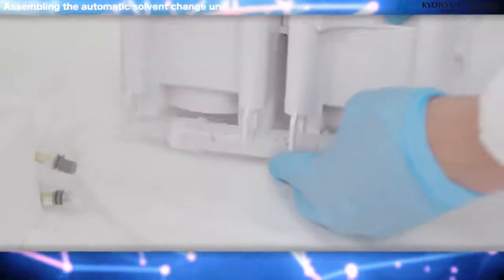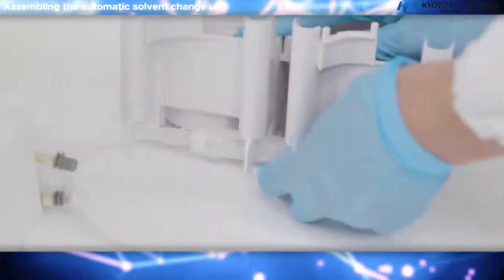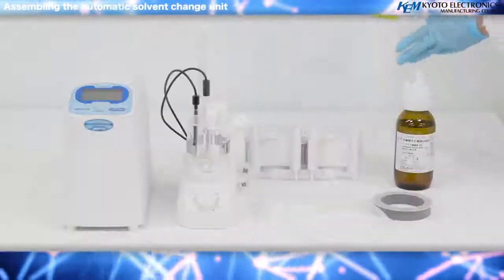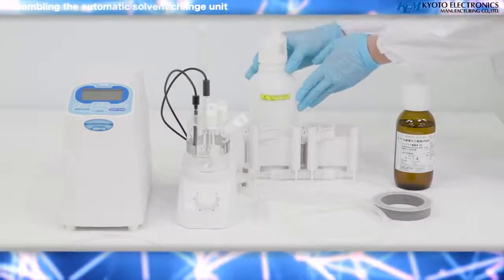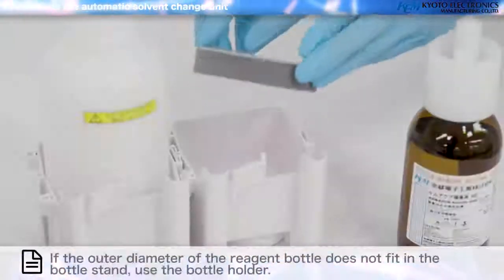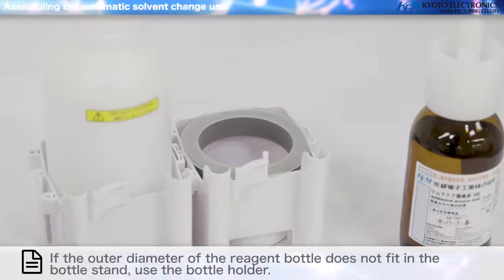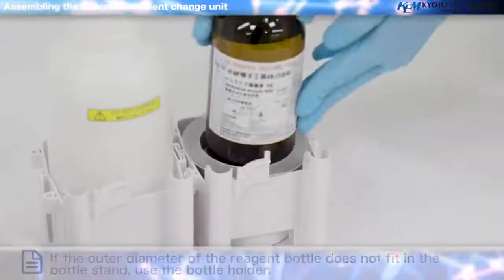Connect the silicone tube to both sides of the drying desiccant tube, and attach the desiccant tube to the bottle stand. If the outer diameter of the reagent bottle does not fit in the bottle stand, use the bottle holder.